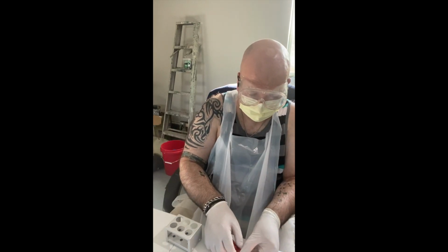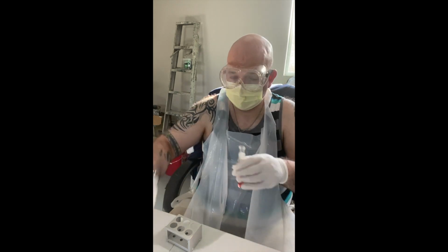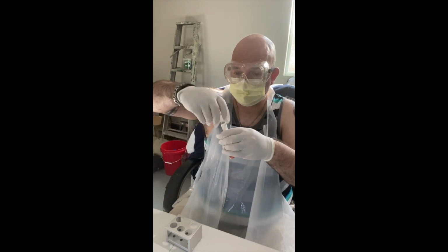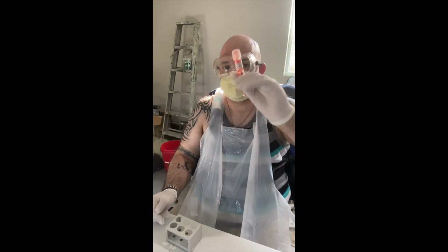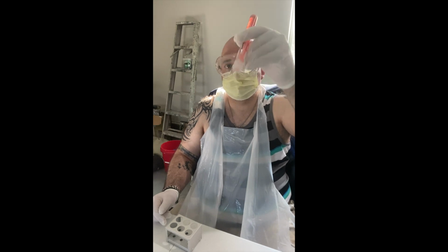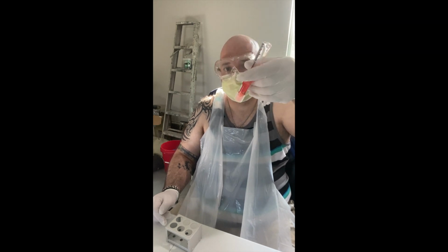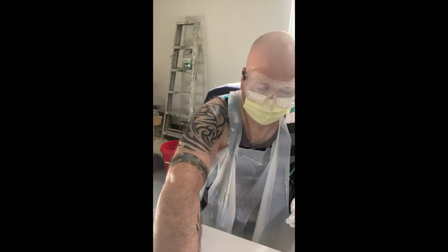Gonna flame this again. Okay. That's been flamed. Lid on. Invert a couple of times to mix. Okay, so that's the glucose.